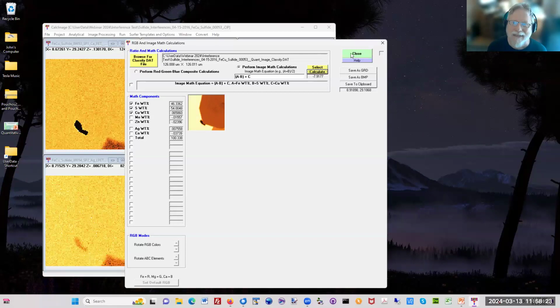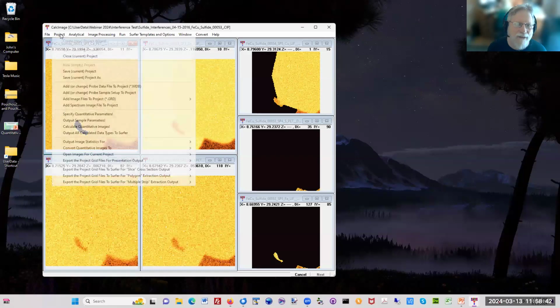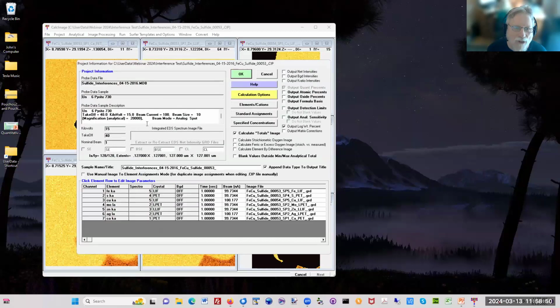Okay, and then Radek has got some more questions. He asked about the detection limits on the map. He says, typically where were the conditions for the map? Okay, the conditions for this map, I think I have it open here. I go here, and the conditions are right here. They were 100 nanoamps. I think that's what the conditions are.